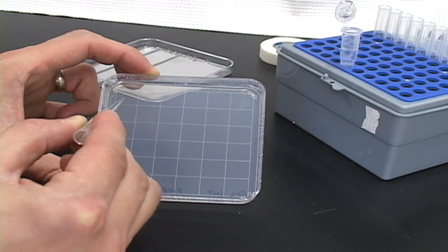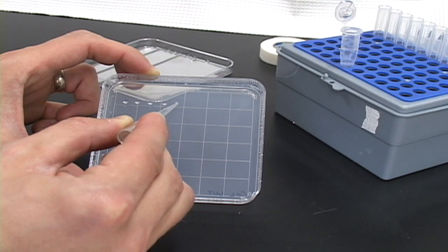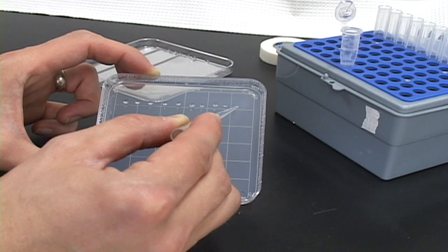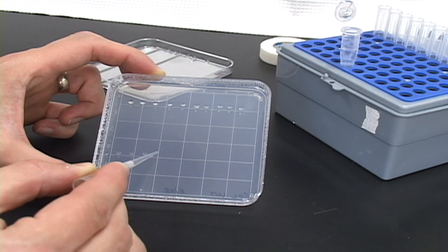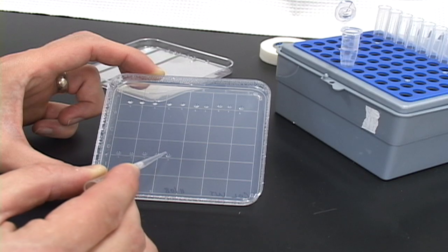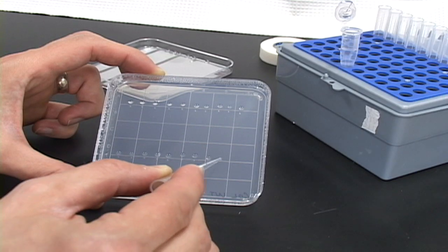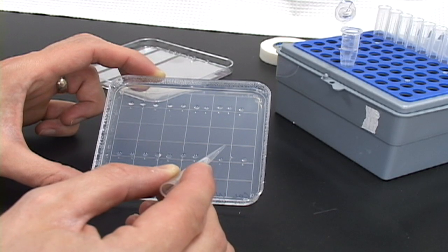Uncover the plate and hold it at a 45 degree angle to the bench. Keep the pipette tip horizontal. Swiftly and gently touch the tip to the agar surface, allowing a single seed to be released with a small drop of water. You can comfortably place 10 to 12 seeds per row and 2 rows per plate for physiological growth experiments. Note that you will need to determine the spacing of the rows based on your growth conditions, whether light or dark grown, for example.